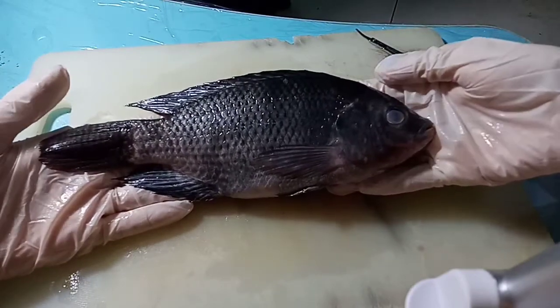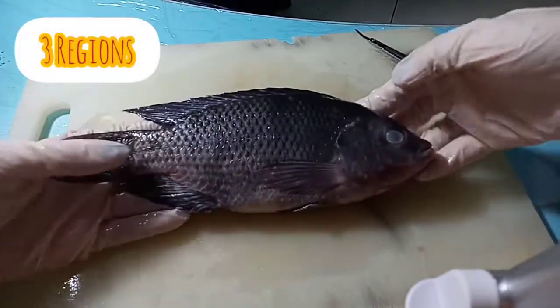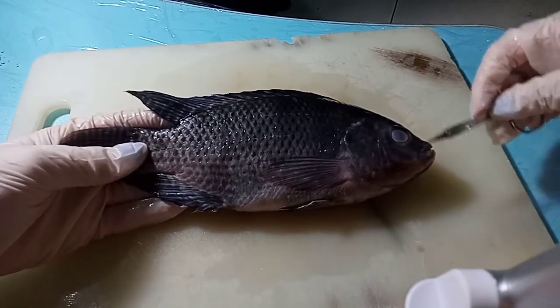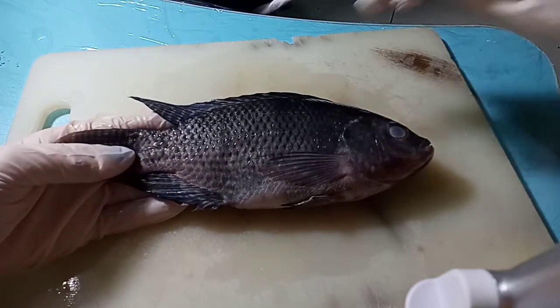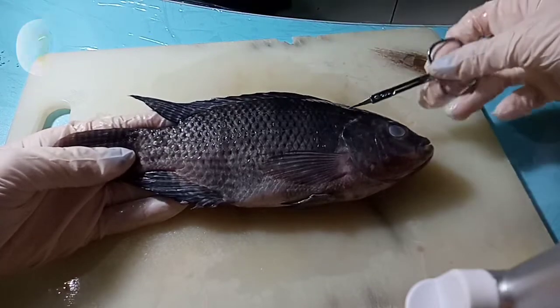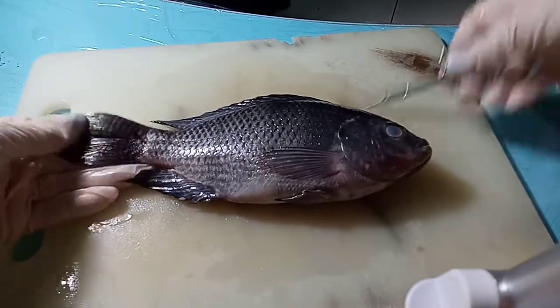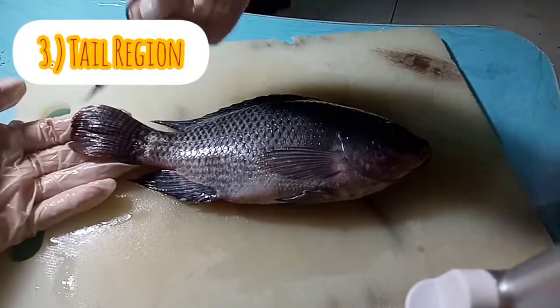It is divided into three regions. This part is called the head region. This part is called the trunk region. And here, on the last part, is the tail region.